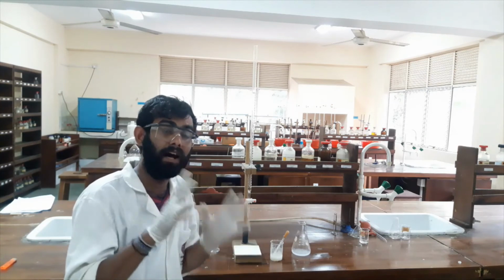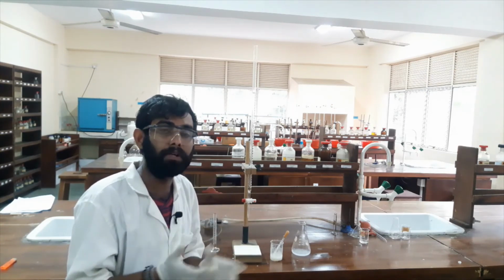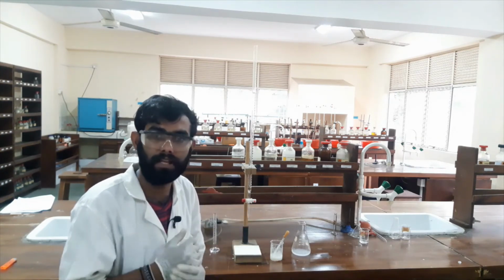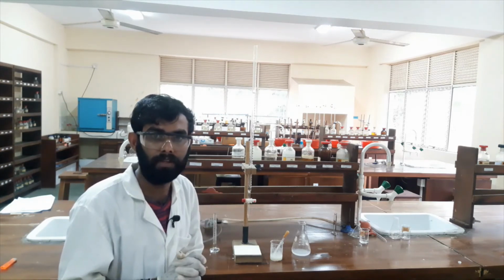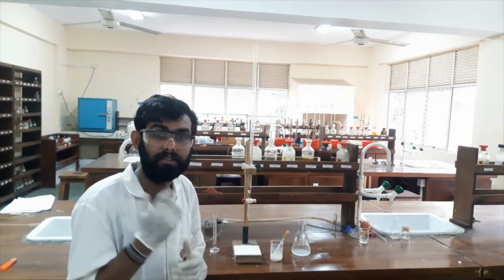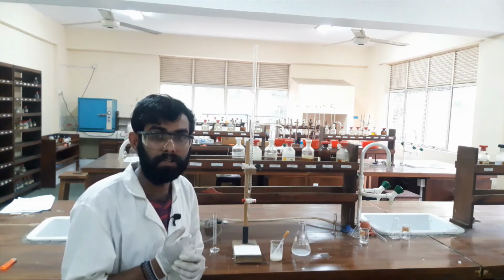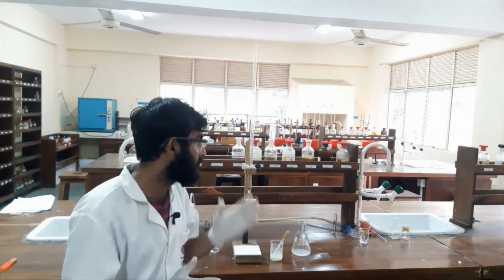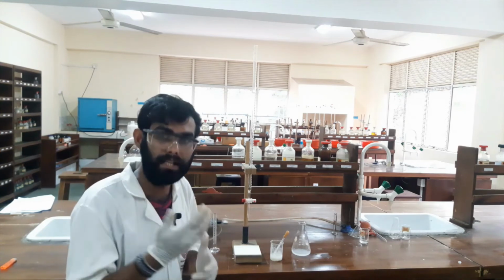However, when there is a high concentration of iodine, the produced starch iodine complex can't break again. It will not dissociate. It will be a permanent complex because the iodine concentration is higher. So initially we didn't add the starch, because the complex is permanent and we would not observe any color change. Because of that, we started the titration with sodium thiosulfate without adding indicator.